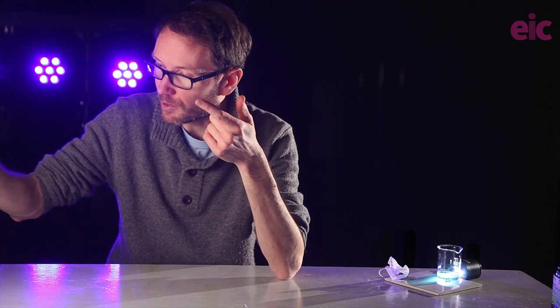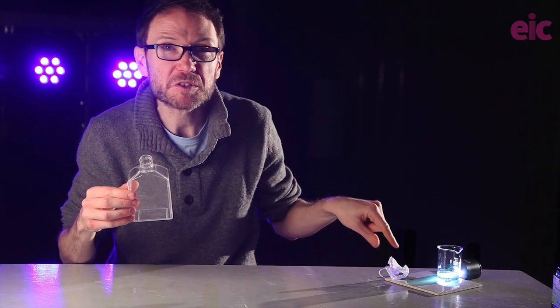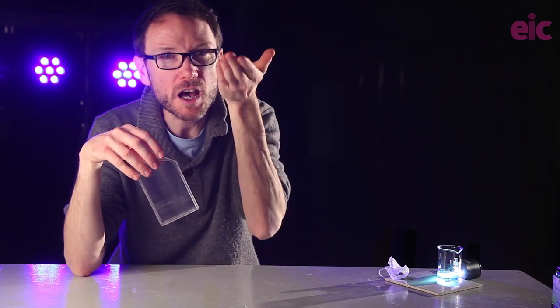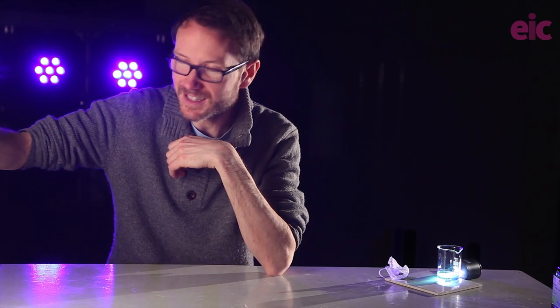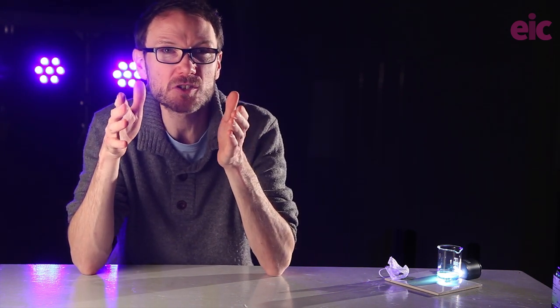So, to recap, we now have an oblong vessel. We're using a tea bag to elevate the zinc, making sure that the bubbles travel up away from the solution underneath and keep that nice color clarity. But we still need this reaction to go faster for a reasonable demonstration that allows for discussion afterwards within the parameters of a typical lesson.